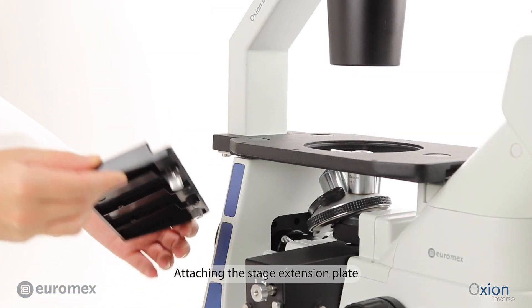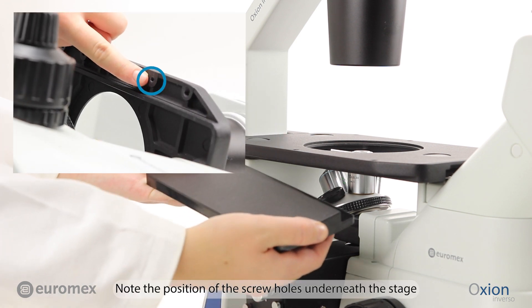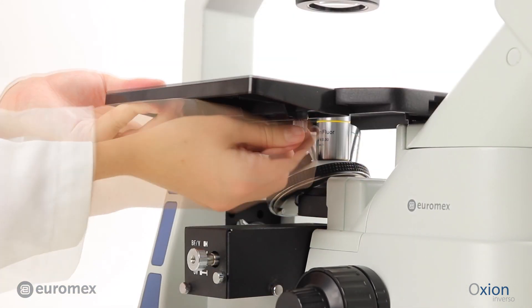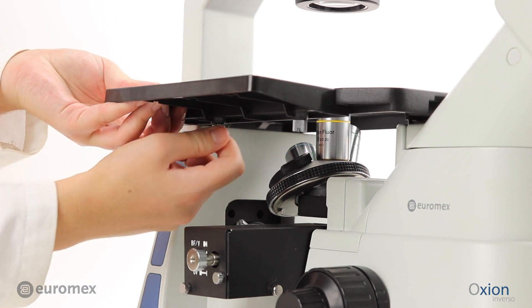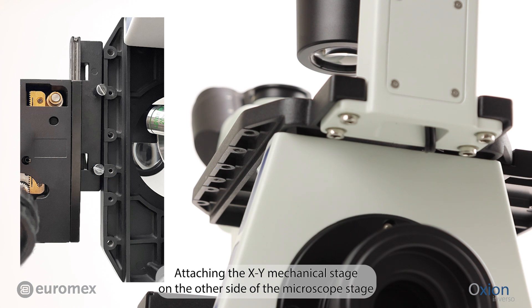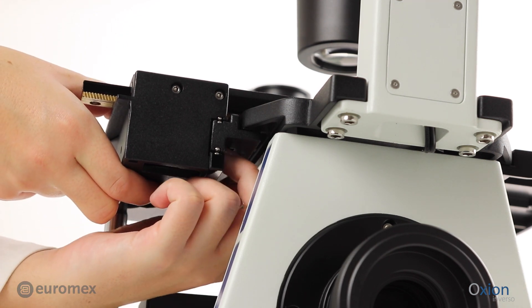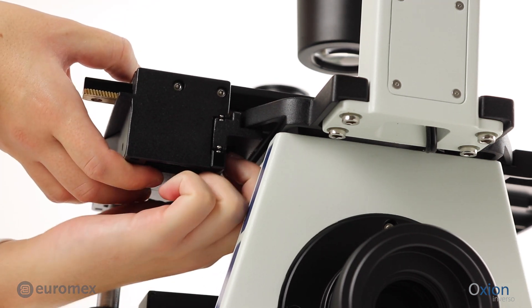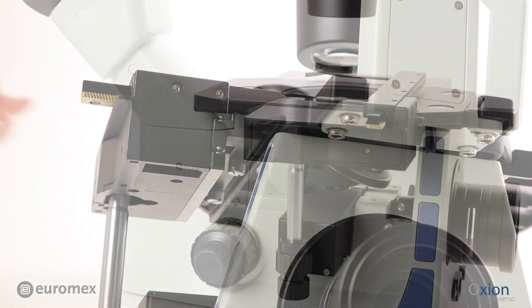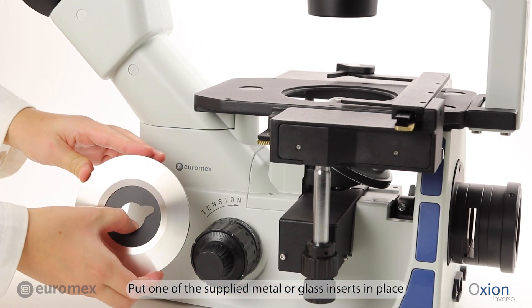Attaching the stage extension plate. Note the position of the screw holes underneath the stage. Attaching the XY Mechanical Stage on the other side of the microscope stage. Put one of the supplied metal or glass inserts in place.